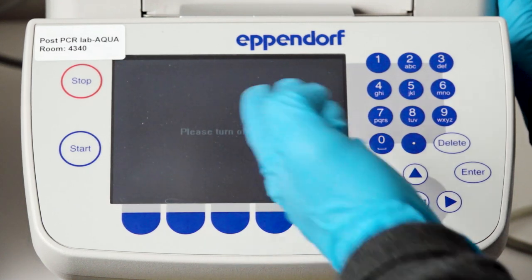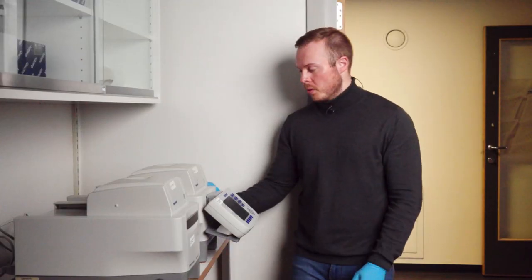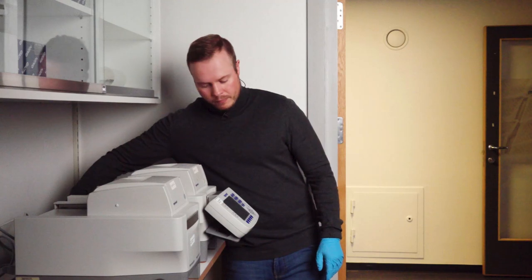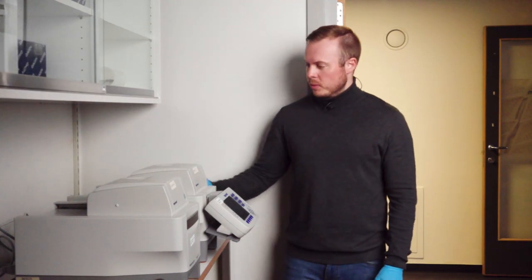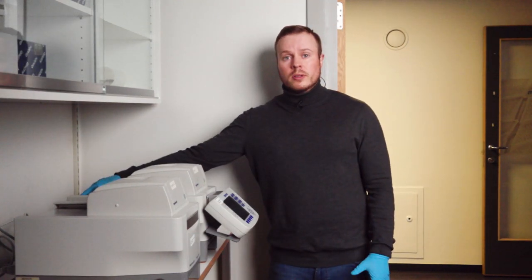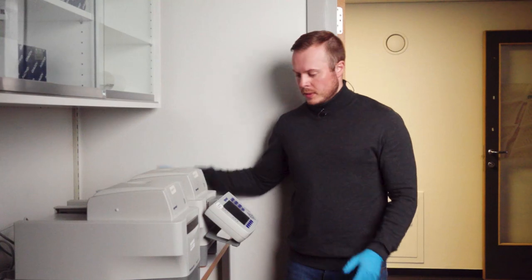This goes quite fast. Then it says please turn off the power, and then we turn off the power on the back side, the same button that we used earlier. And then move to the post-PCR lab.